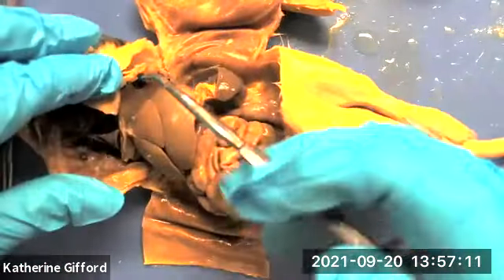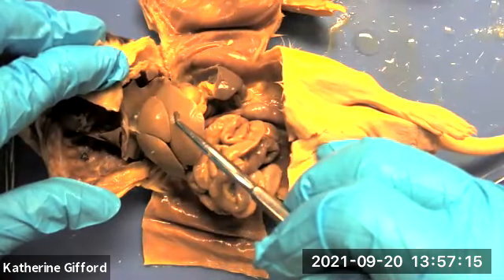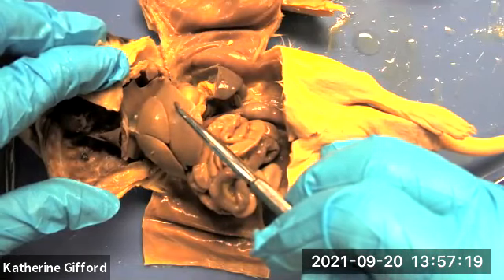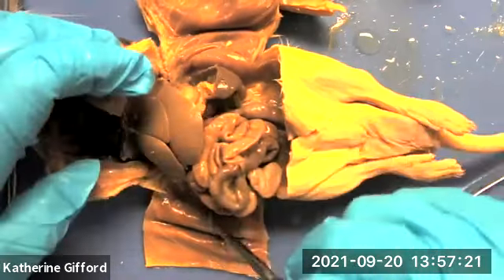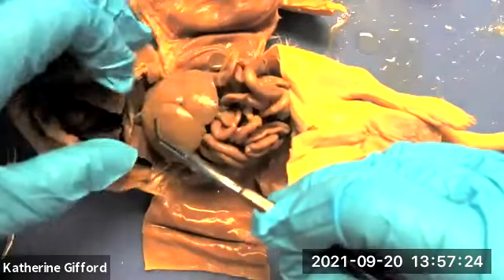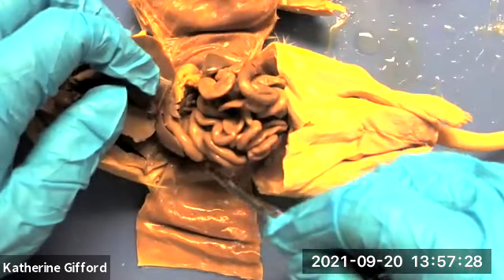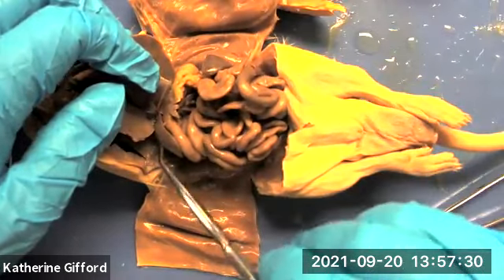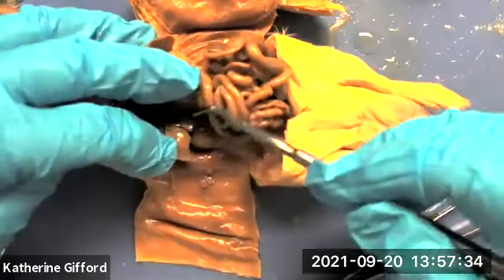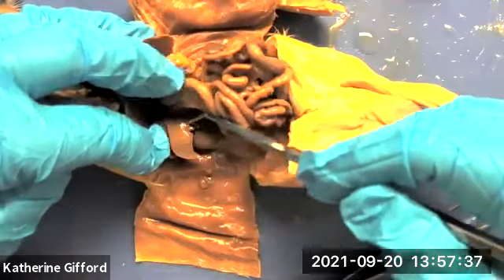Going back to look at the liver: the left lobe is going to have two pieces and it's much bigger than in humans. Then we have the right lobe of the liver, the quadrate lobe of the liver, and then the caudate lobe of the liver.